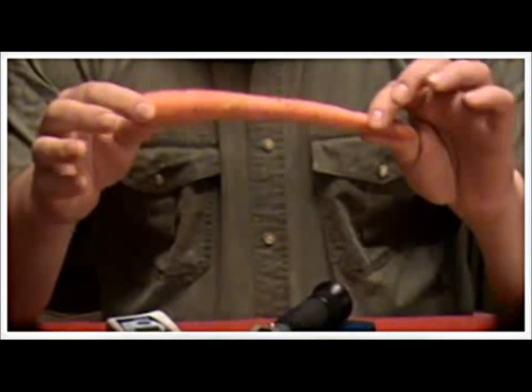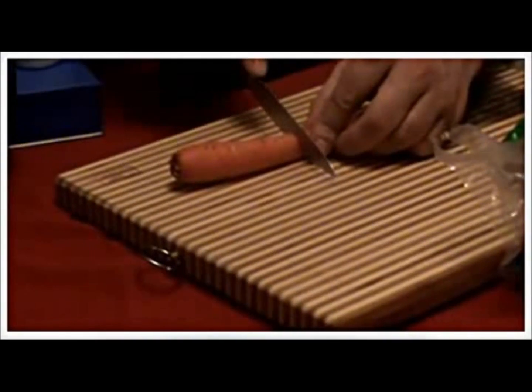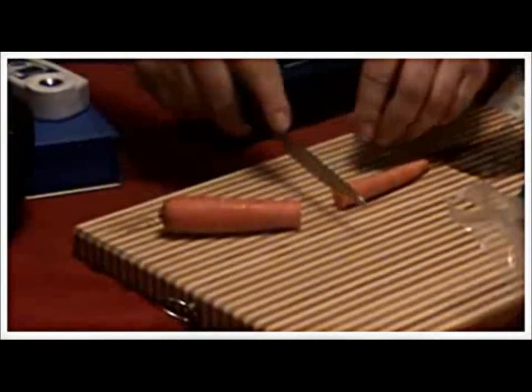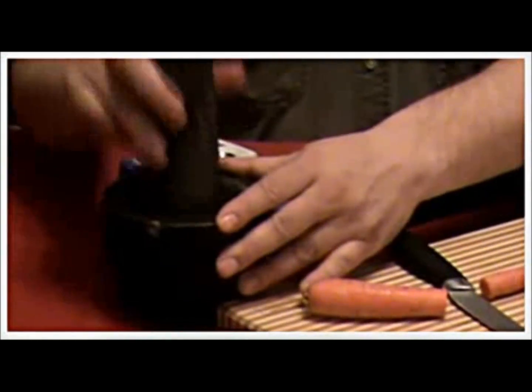You can take it at the tip, middle — how do you do that? Well, there's no right and wrong, but my suggestion is to take the carrot, cut it in half, and from the side of the half take some to do the Brix reading. Take it out of the middle section. Put it over into the mortar and pestle and start pounding. The reason we use a mortar and pestle is we want to rupture all the cells and reduce this carrot down to a pulp.